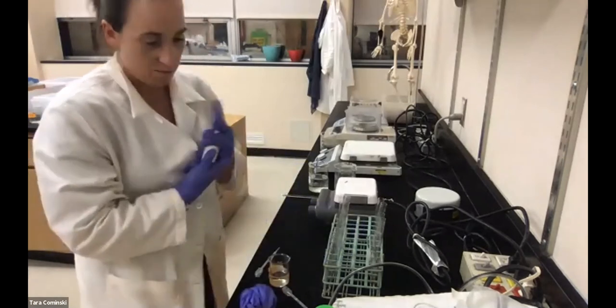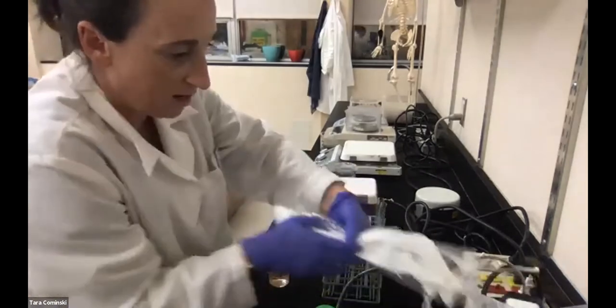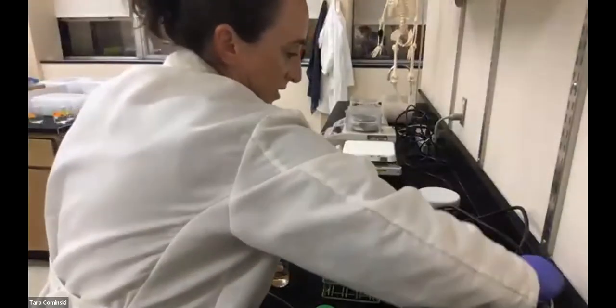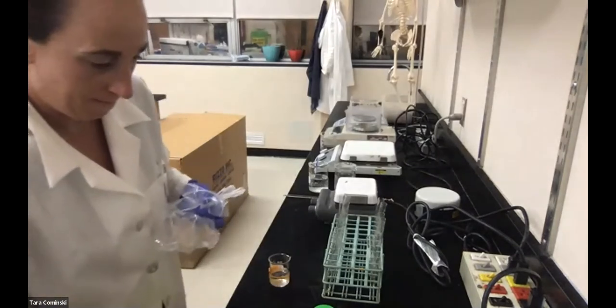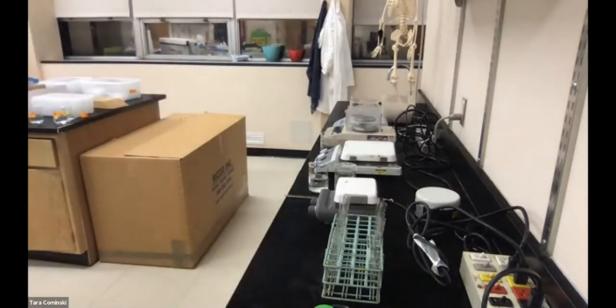All right, let me clean up a little bit. This is just like in the kitchen. It's not good to be a messy chef or a messy scientist, because then it makes for messy data. So let me move this out of the way, because all this is doing is cluttering my space. We will eventually have to add peroxide too. I need one more transfer pipette, so I just threw mine away.